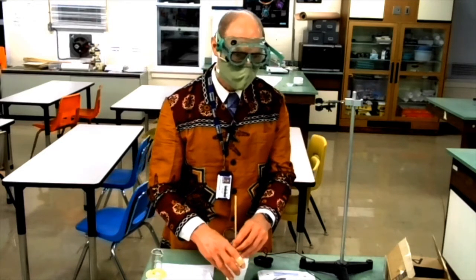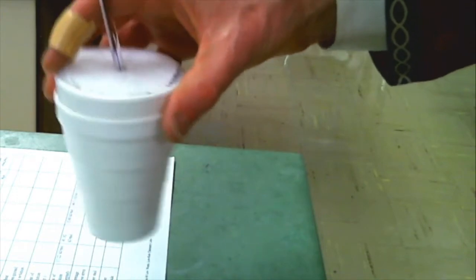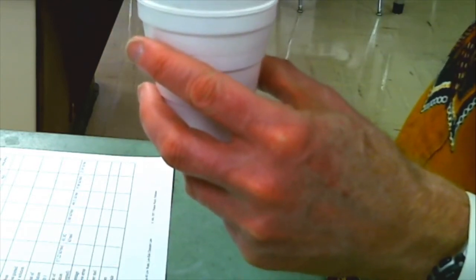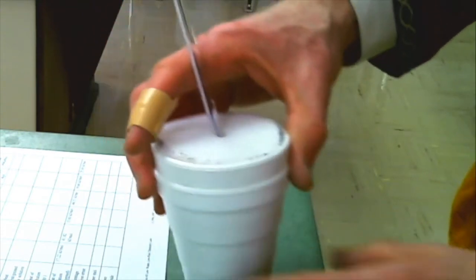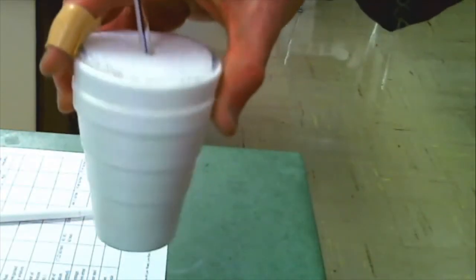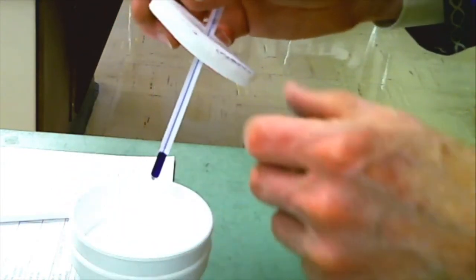I'll stir with the thermometer, or even better, slightly swirl. It looks like the temperature is dropping. The temperature is now at about 17.5 degrees Celsius. Still 17.5. I'll write that down and check if it changes any more. Again, still 17.5 degrees. It looks like the potassium chloride is completely dissolved — there does not appear to be any undissolved solid.